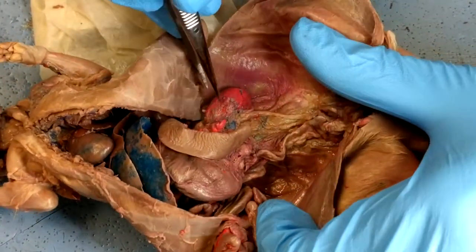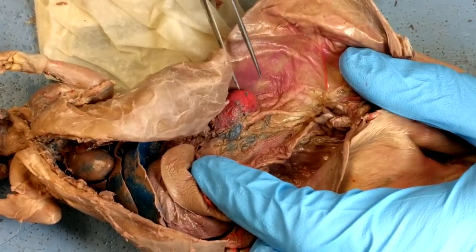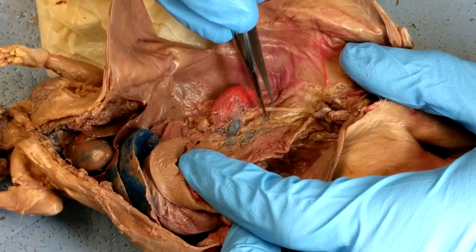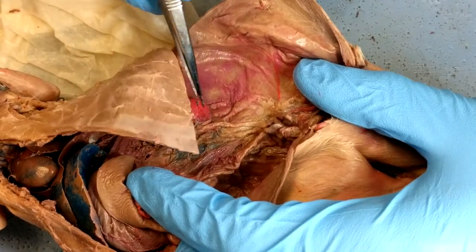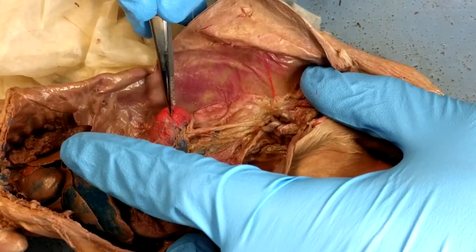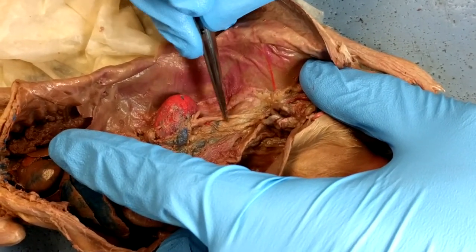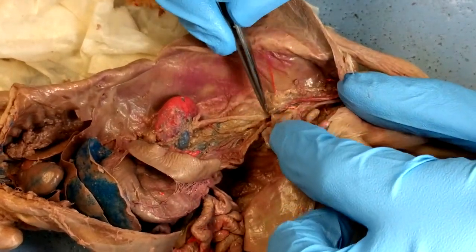Staying with the kidney, one of the structures you had to identify was the ureter, which goes from the kidney to the urinary bladder. That was this tube going straight down. If you pull the kidney up a little bit, you can find it — a lot of the time the ureter is embedded in a bed of fat. But that leads to the urinary bladder.